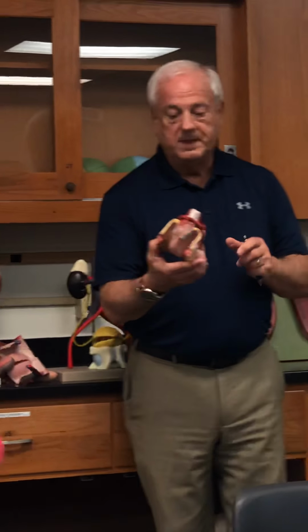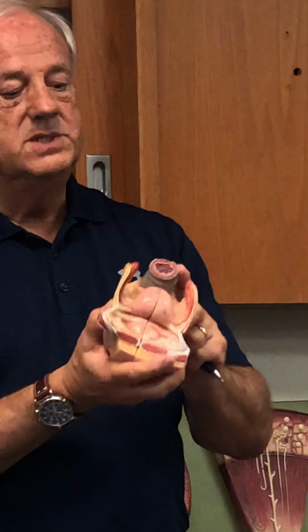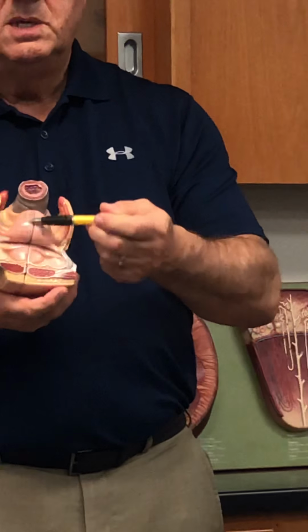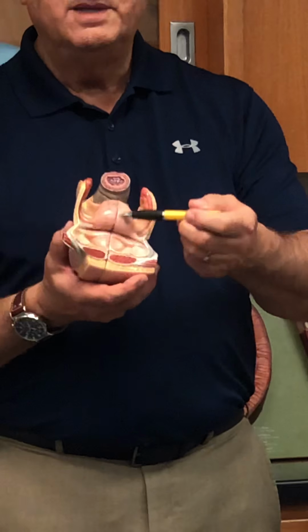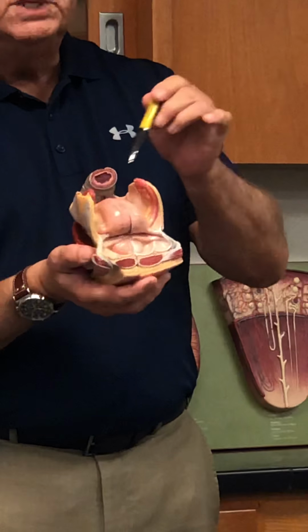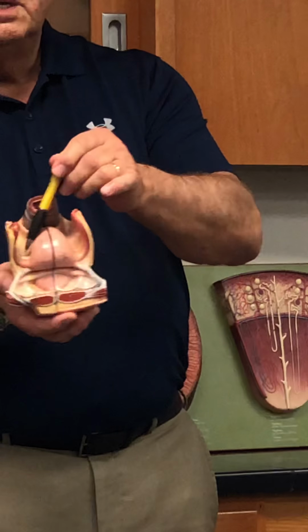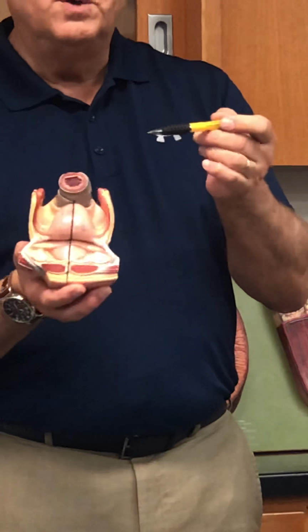Okay. The external genitalia of the female. Right. You begin to look on the inside. You can see it's very close to the rectum. Here's the anus right there, rectum. Very close to the rectum is this structure. What's that? Uterus. Okay. Associated with the uterus, you can actually see ligaments. What are these ligaments called? Since they're associated with the ovary, they're called ovarian ligaments.